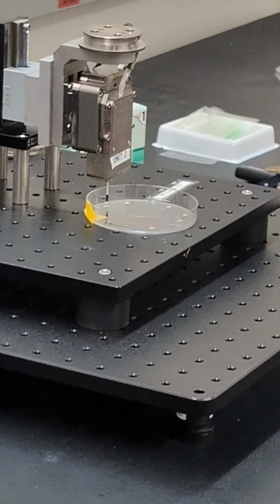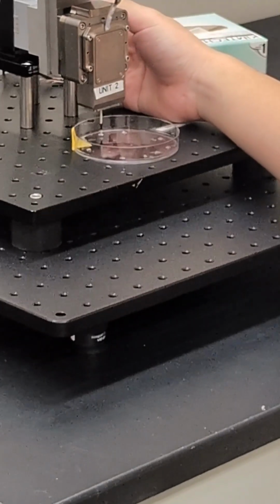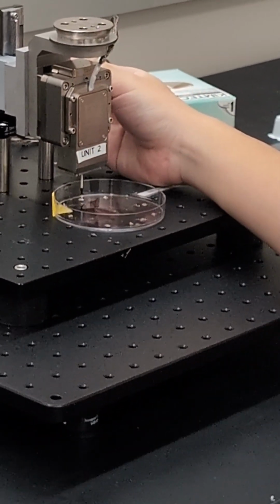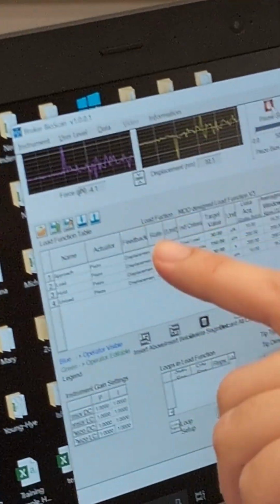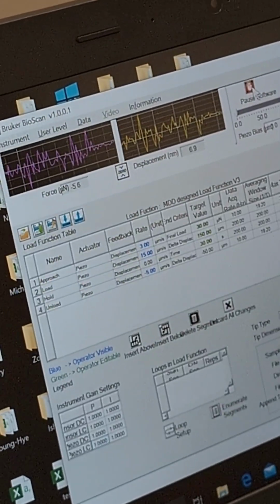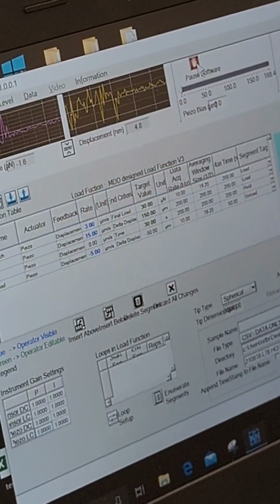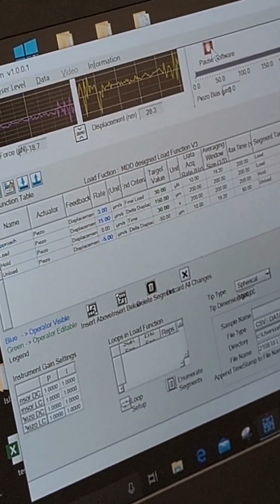Okay. I'm going to start the software, and I may need a little bit more space. So I'm going to very slowly, gently lower the knob. Basically lower it down. Pay attention to the actual force value here. Ideally, you want to see a larger negative force start to show up here. That means the hydrogel is making contact with the probe. Because the hydrogel contains water, it is the water tension that's pulling the probe down. So from that point, you know the probe is actually in contact with the hydrogel.